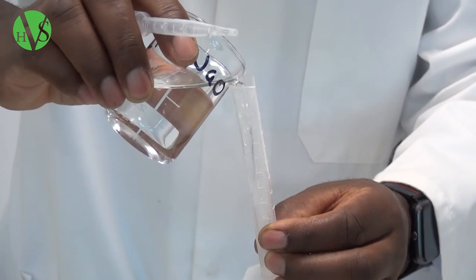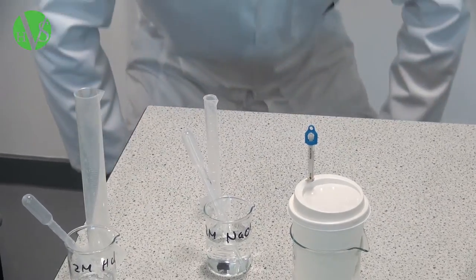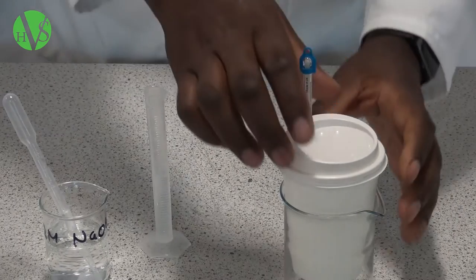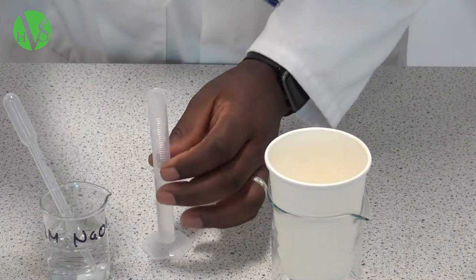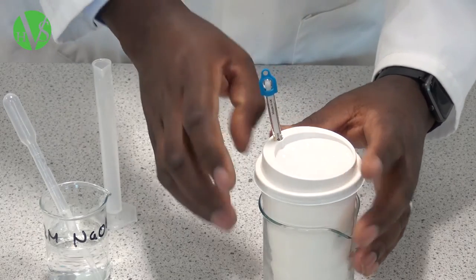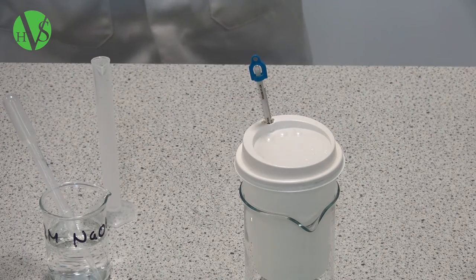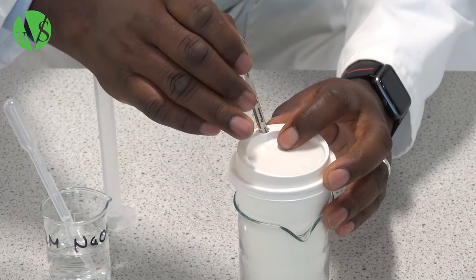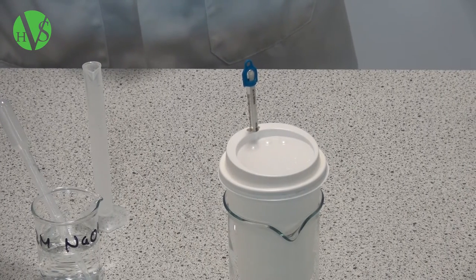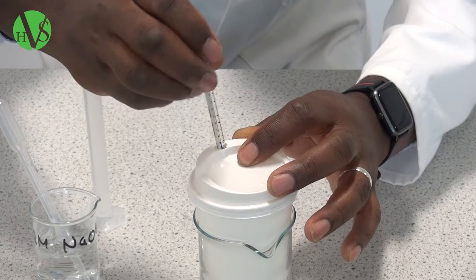We then measure 5 ml of sodium hydroxide into the small measuring cylinder, and add it into the acid. We replace the lid and give it a little shake just to make sure that the two solutions mix. Then we have to take the maximum temperature reached by the solutions — give it a little time just so that there's a reaction. That's about 23 degrees Celsius, and we record that in our table.